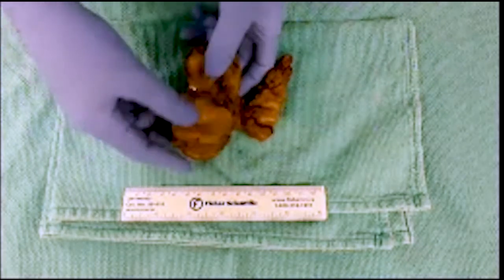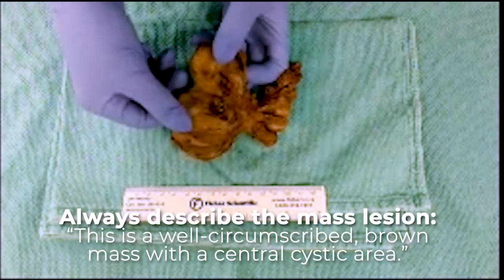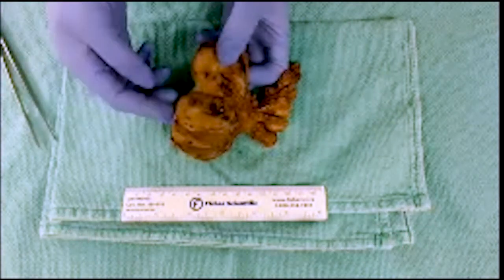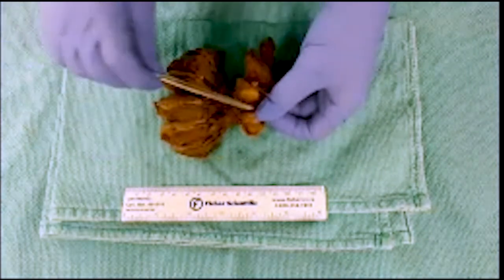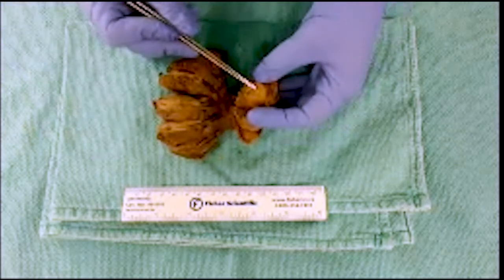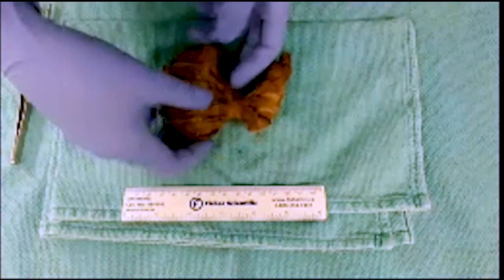I would then describe the appearance: it is a well-circumscribed brown mass with a central cystic area. You can see it looks cystic and hemorrhagic at the center of this lesion. When you compare that to the contralateral lobe, the mass is also similar in appearance — that tan-brown homogeneous look with some central areas of hemorrhage.